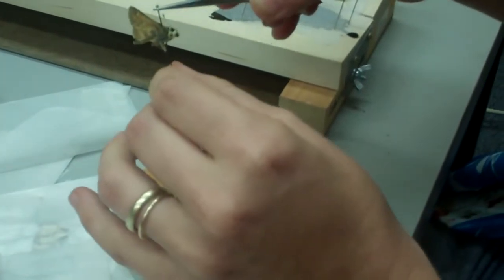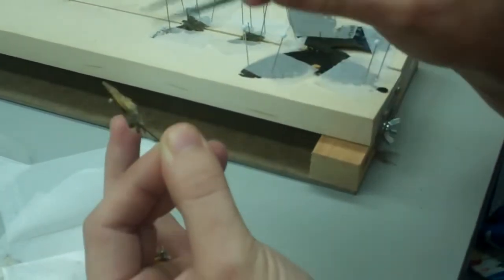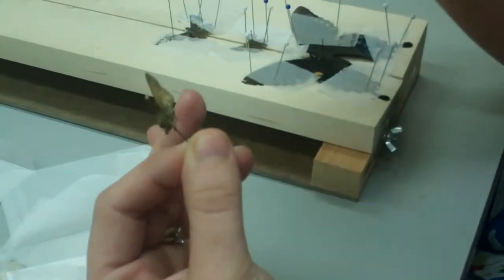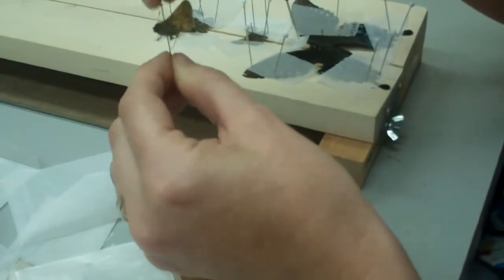And that's just to move the pin down further on the butterfly. And if I use the pinning block, then they will all be more or less even. Gotcha. Alright. Oh, so that's why mine aren't. Awesome.